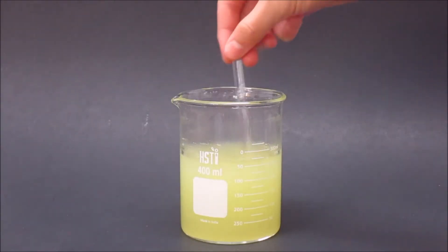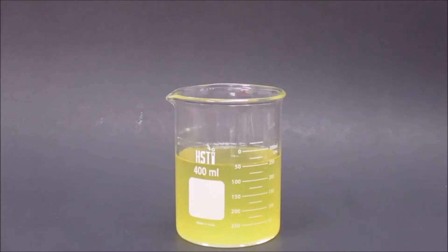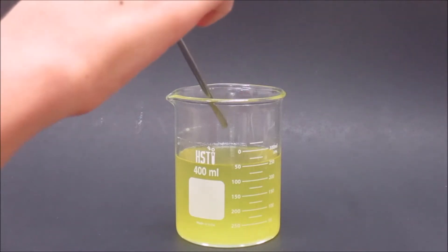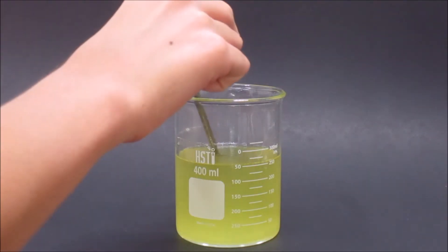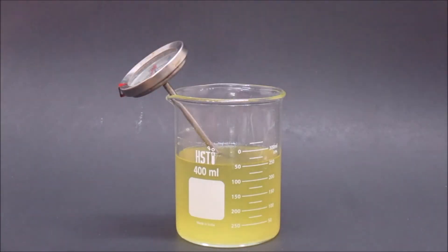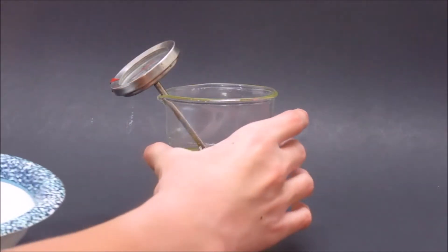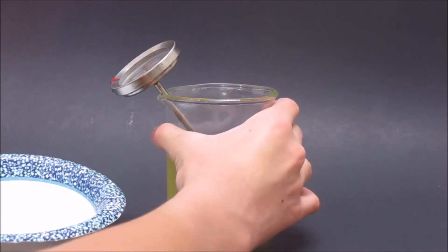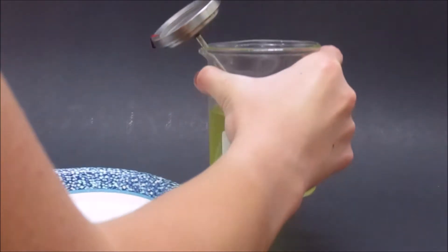After a while, I stirred it around a little bit more. I then added a thermometer to test the temperature. I added the thermometer mainly to test to see if the solution was hot enough to boil chloroform, and then I added it to an ice bath just in case the bubbles were chloroform vapor.